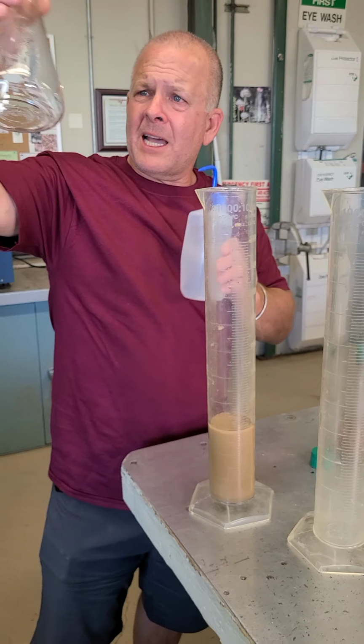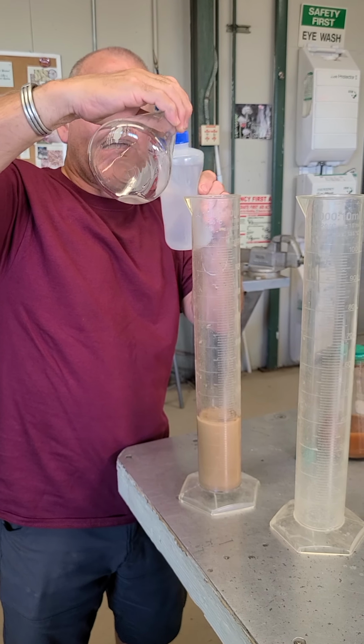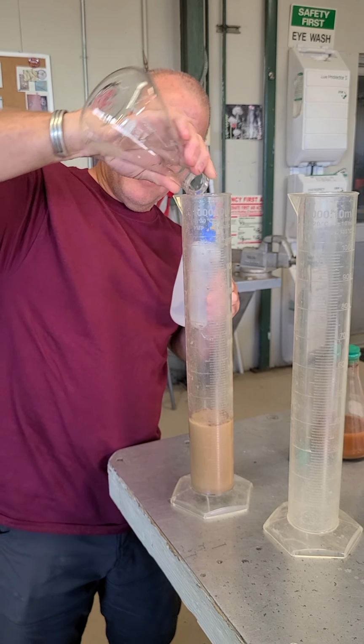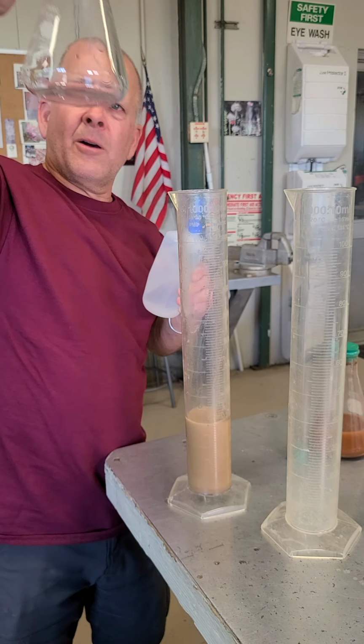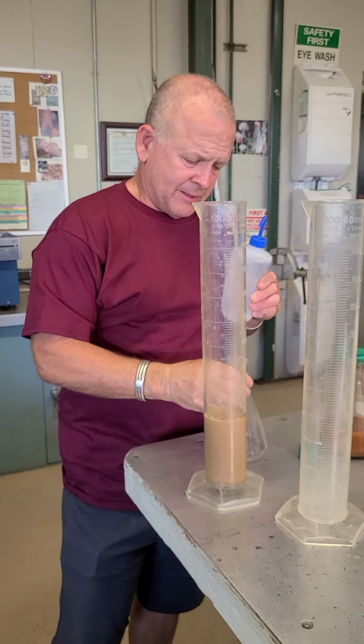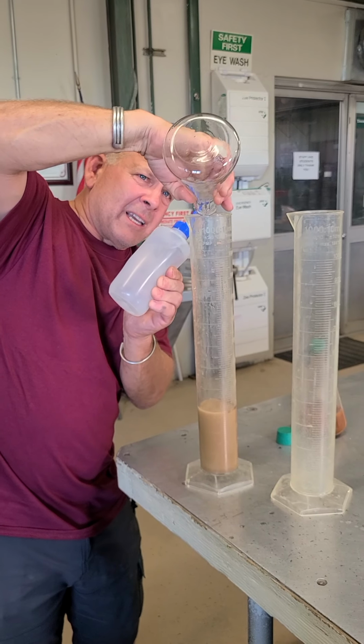So that's actually, well, I can see still a little bit more in there. What you'll find out is some of the sand particles will stick to the side. So we're actually pretty good. If you look at that, it's pretty good. I might have just a tiny fraction of something in there. I can try it again a little bit more.